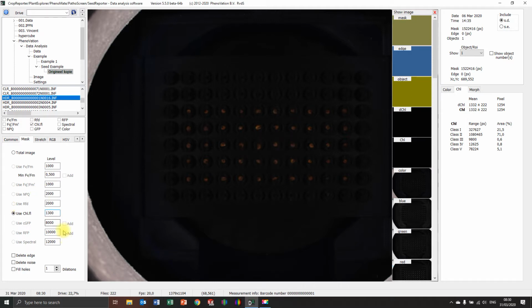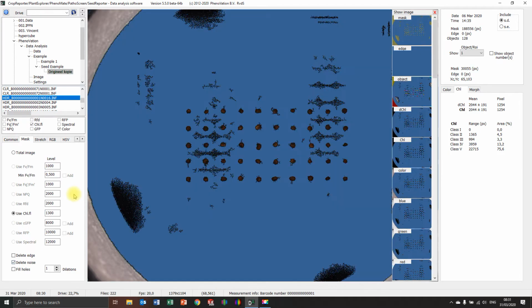Range check error. So something has happened. Let's see if I can fix that. Range check error normally comes when the setting is not really proper. I now deleted the noise, so probably there were too many objects. You can also see we still see those borders. We have a special trick on this camera system to make the light homogeneous.